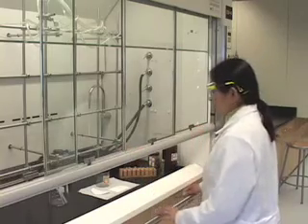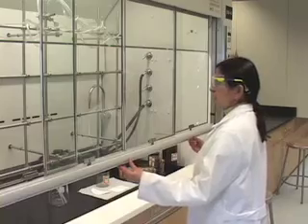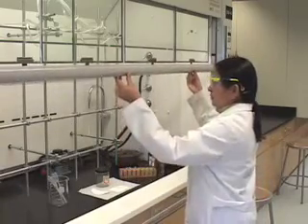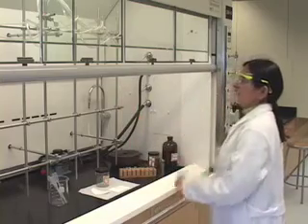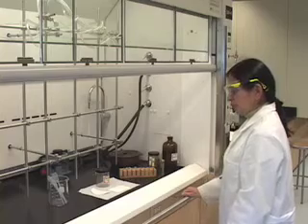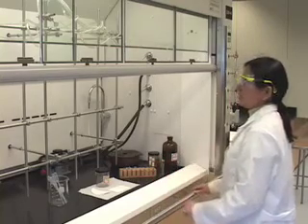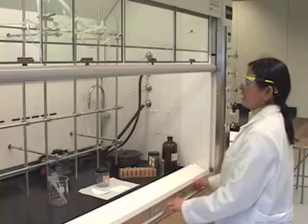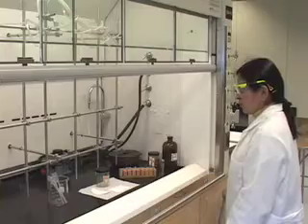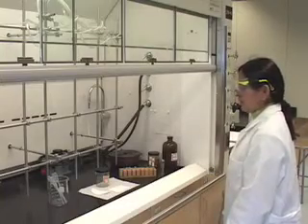For our video recording purposes of the demonstration, we will be working with our hoods raised all the way just so that the reflection of the glass doesn't interfere with our recording. So please note that this is not the correct way to be working in the hood, but we have the hood sashes raised only so that the glass reflection does not interfere with our recording.